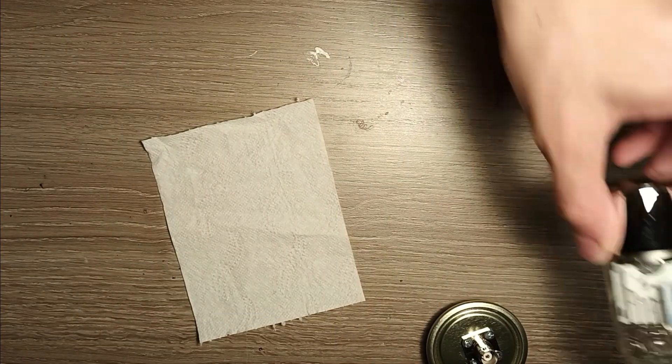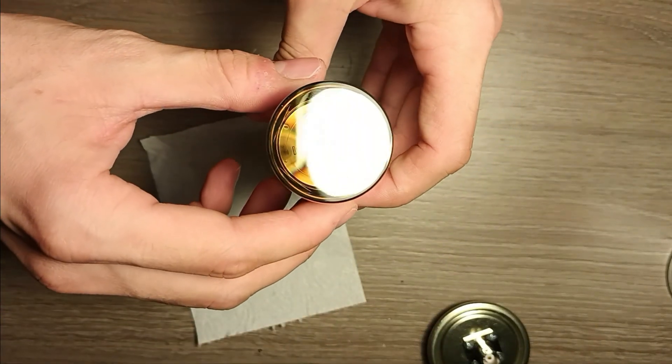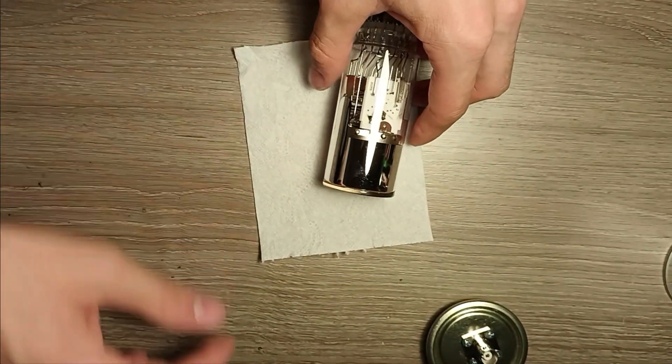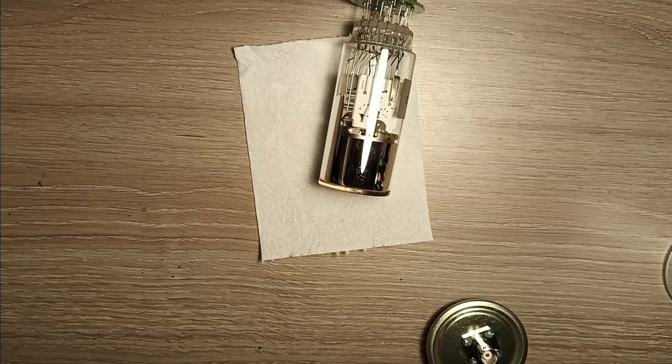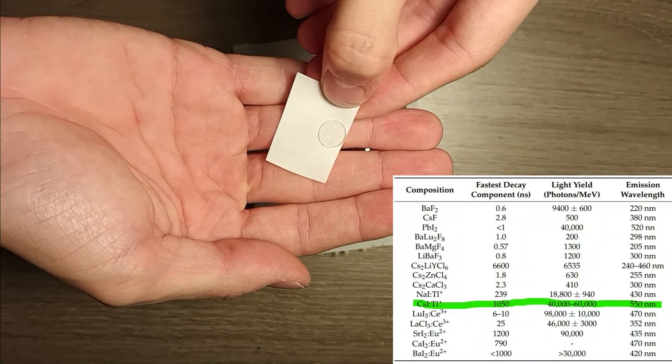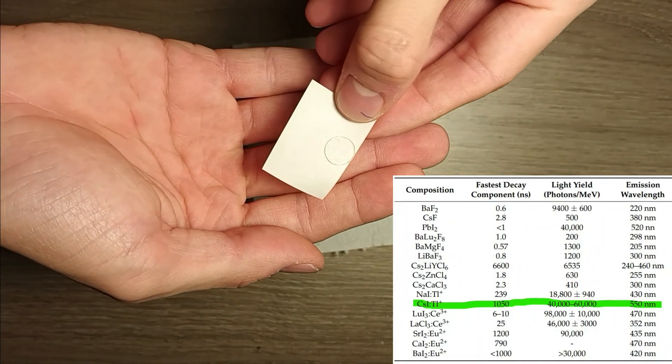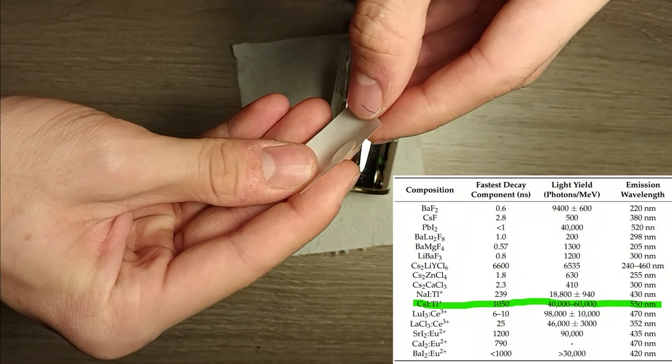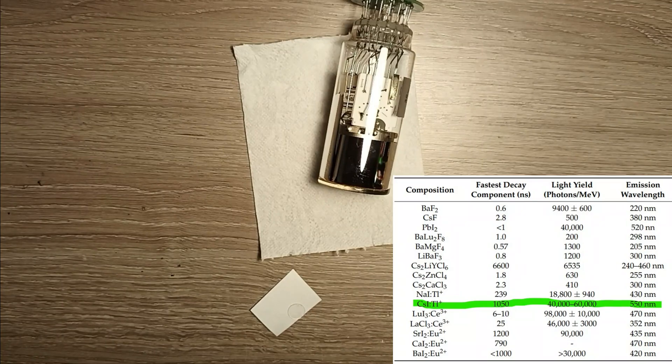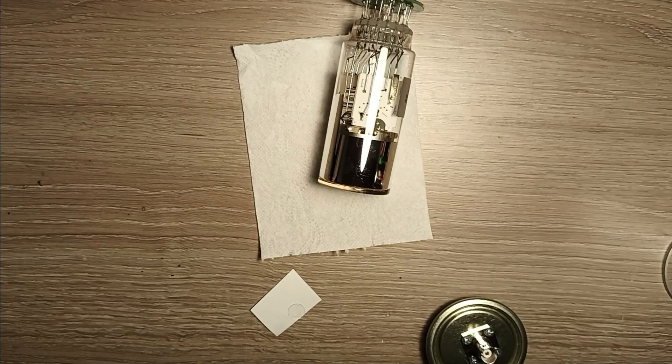Choice of the crystal is another important topic so I chose a material with a thickness range of about one millimeter but it also has to be thick enough to completely stop X-rays, and I'm interested in the region between one and a hundred kilo electron volt. This is the disc of cesium iodide that I'm going to use. It's a salt so when it will be irradiated it will emit green light.